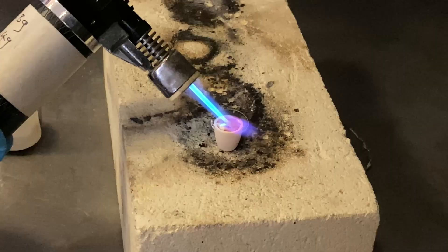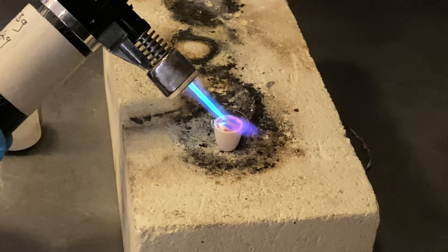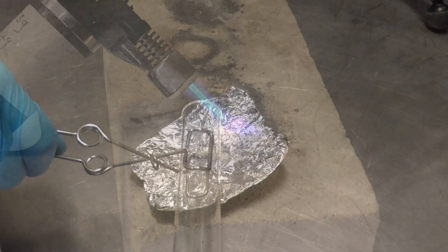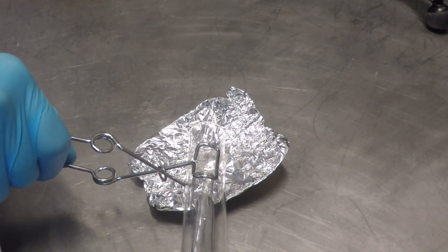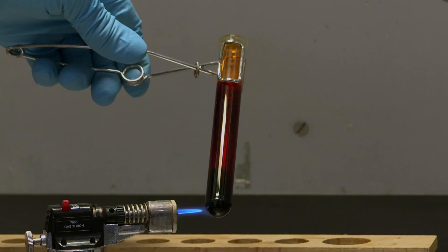Indium is a really fascinating material, and we're going to show you why it was called indium, how you can mold things out of it, and how you can do some reactions. And Neil's going to have some real fun.